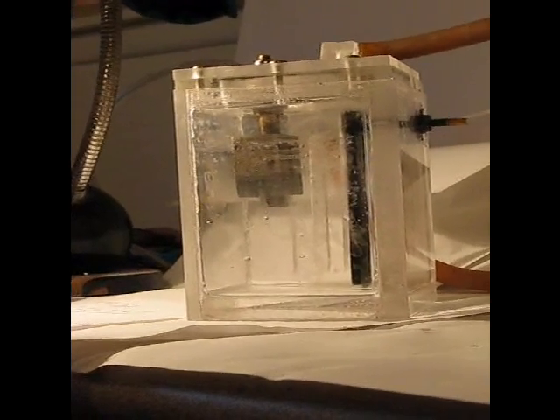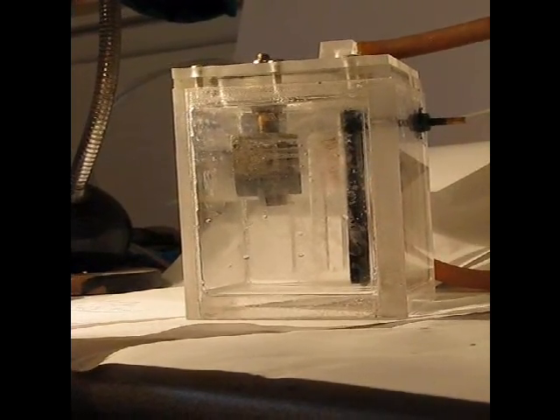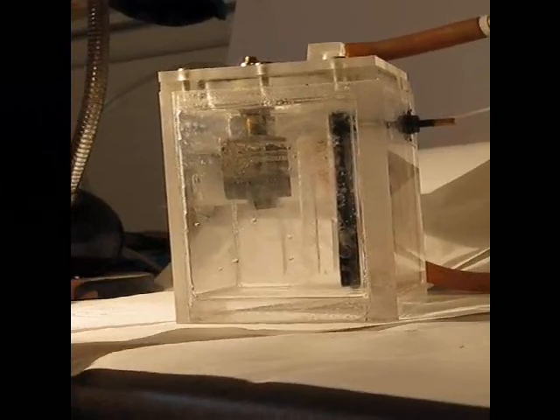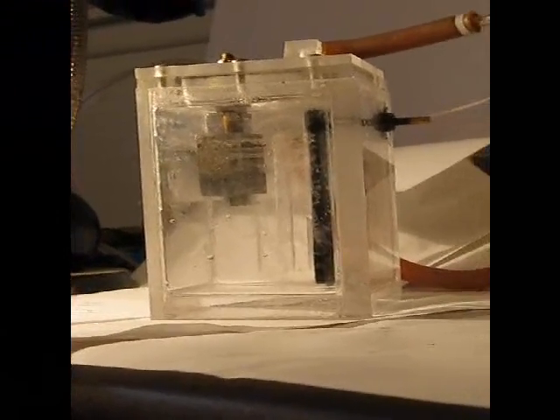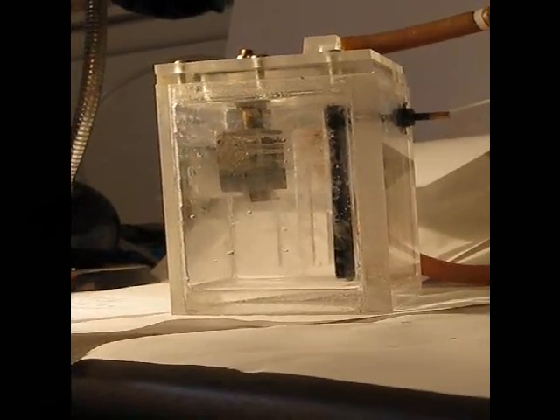Hello, I'm Dr. Griffin. What I'm going to show you today is a unique reaction. I'll be reacting aluminum in a controlled manner.